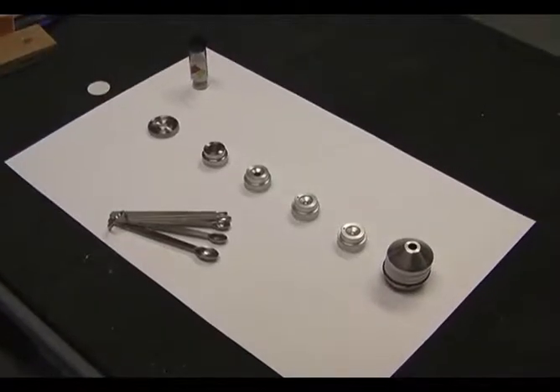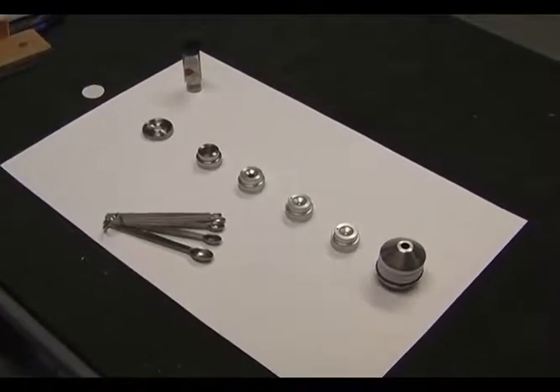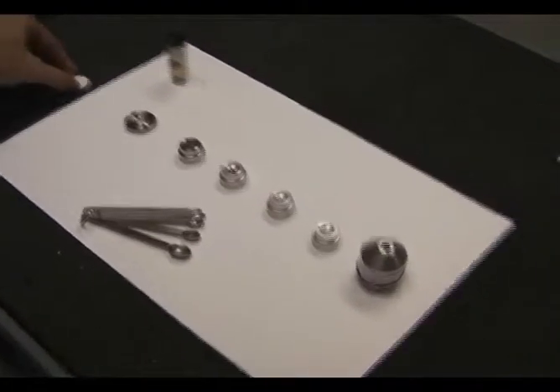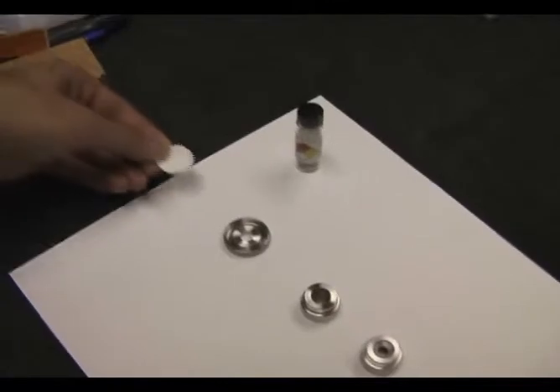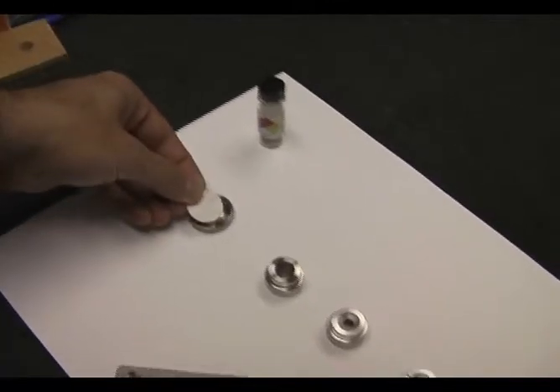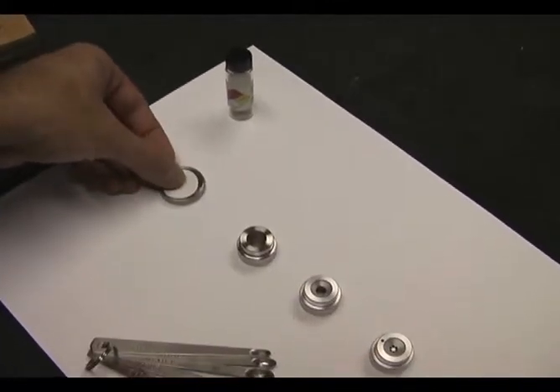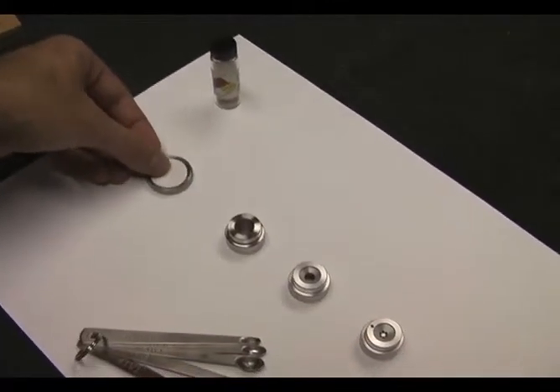The first step is to prepare the sample inside the nozzle. The first thing you do is grab one of these little filters and put it on top of the base.